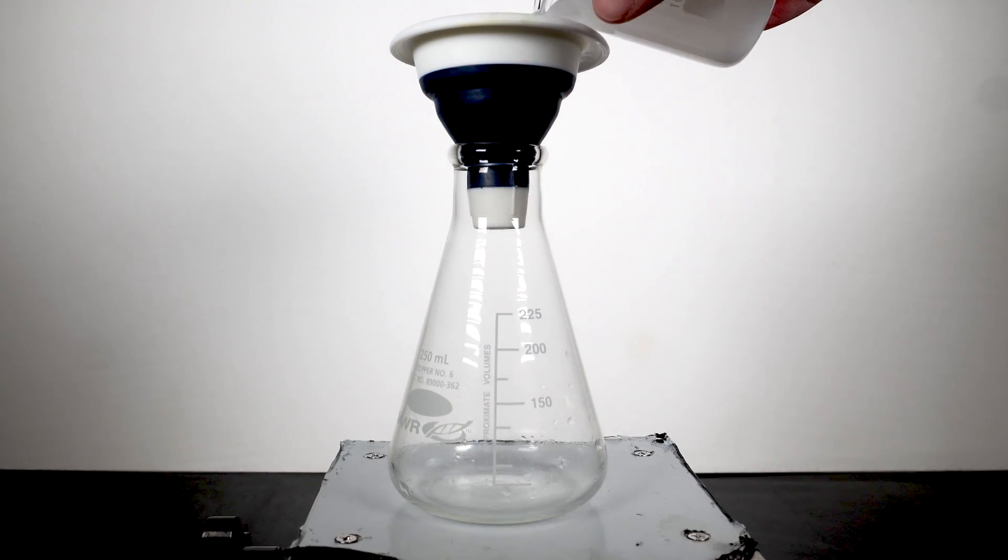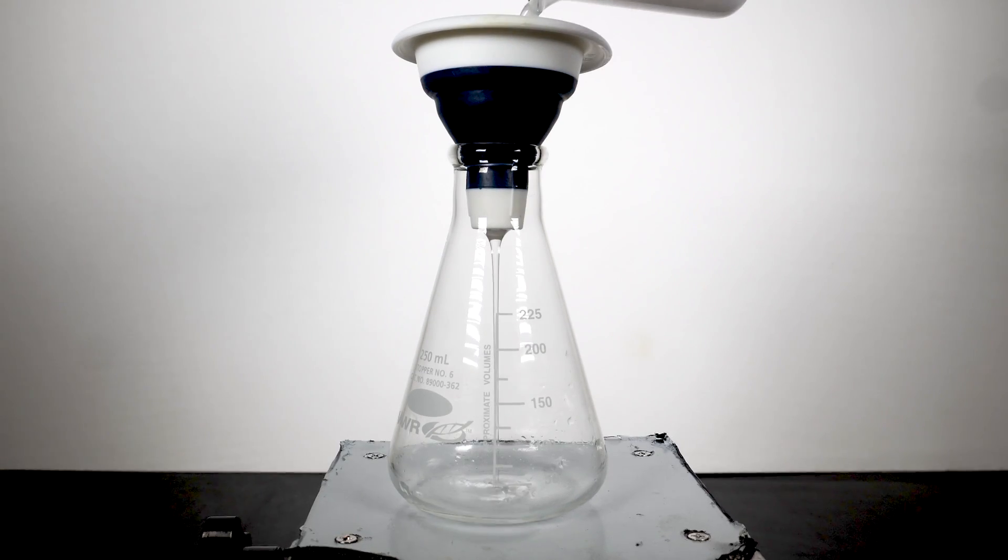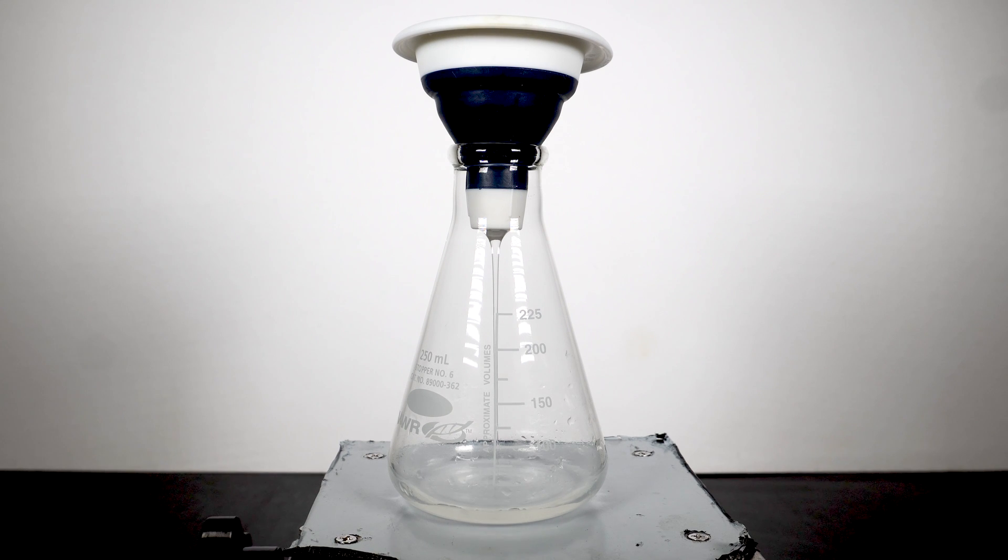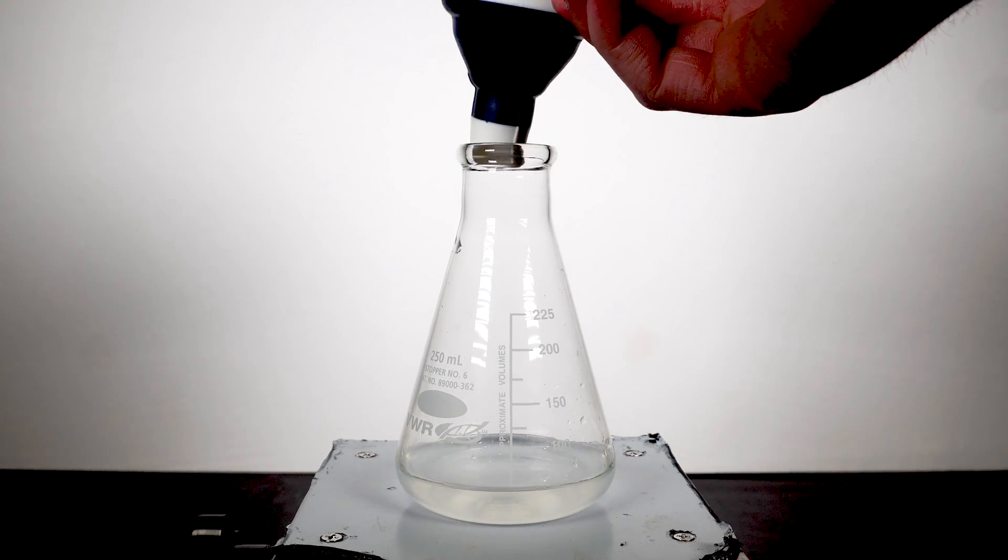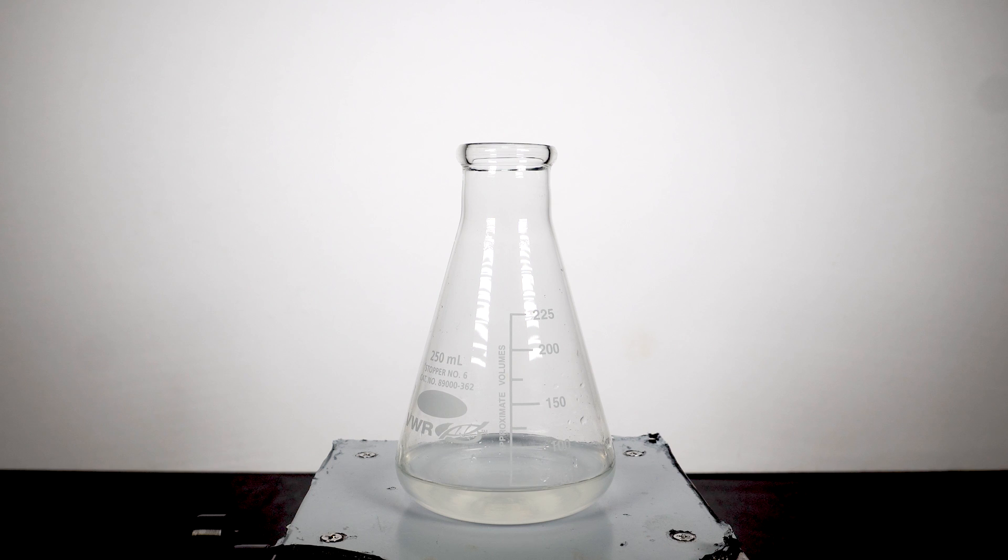This probably isn't 100% necessary, but it does make the end solution cleaner. Doing this is easy, and I just use a small funnel and some cotton to filter it. Coffee filters can also be used in this step if cotton is unavailable. Once everything drains through, we can see I have a nice clear solution of vitamin C in water.